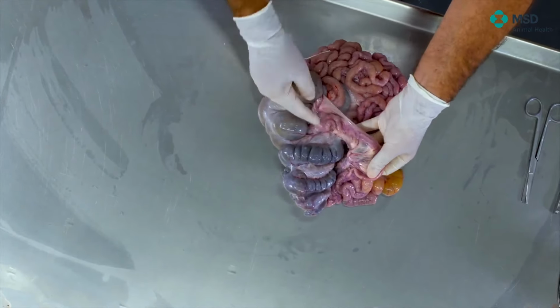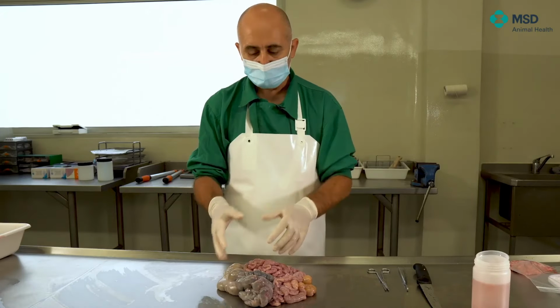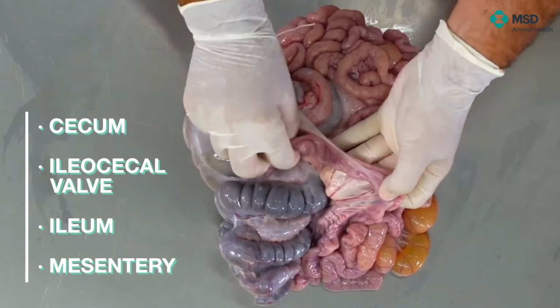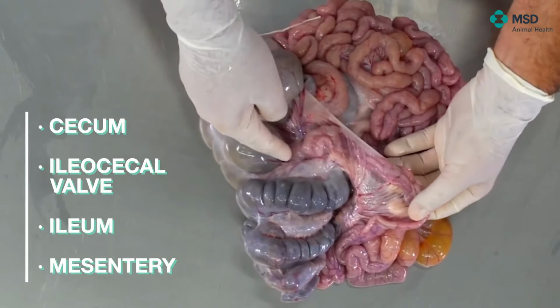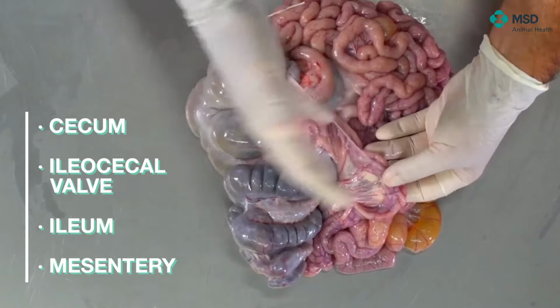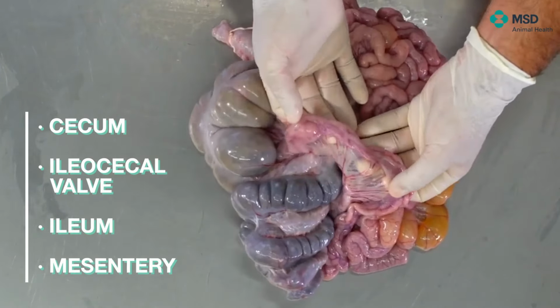However, as long as it is attached to the cecum, we will never lose this reference. Of course, if we have the whole package and I'm looking at it that way, it can be difficult sometimes. So try to look for your reference, and the reference is always the cecum. Then it could be interesting as well to take samples from other different parts of the small intestine, because of course we can think of clostridiosis. Most of the Clostridium perfringens mainly are affecting the small intestine.